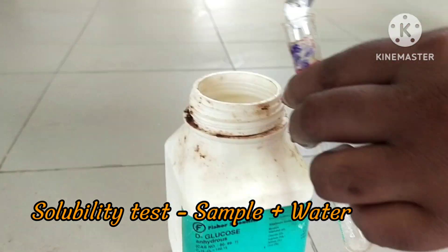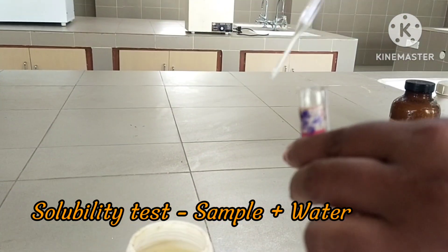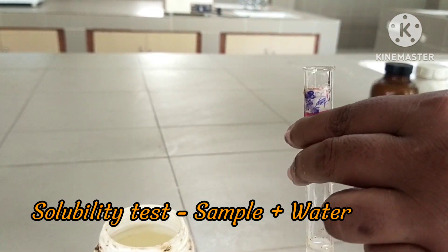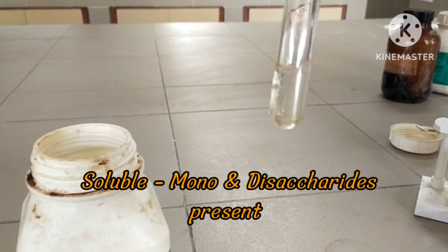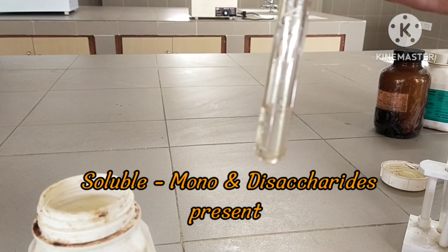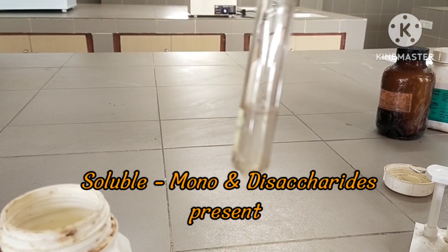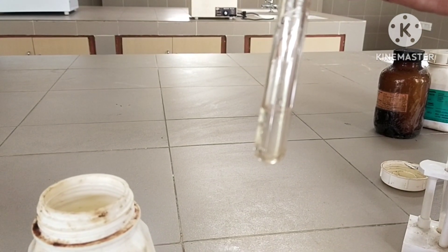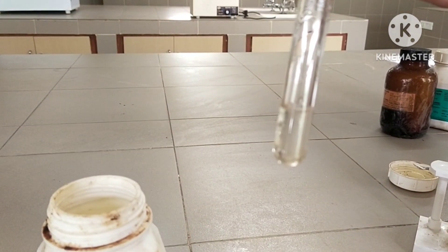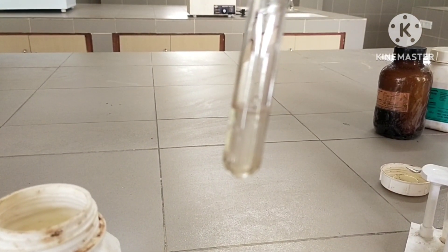Solubility test: To the sample, add distilled water. If the sample is soluble in water, it represents that monosaccharides and disaccharides are present. If the sample is insoluble in water, it represents the presence of polysaccharides.